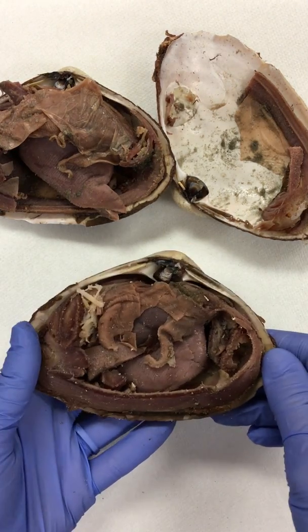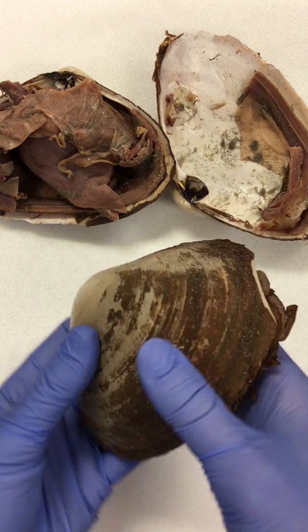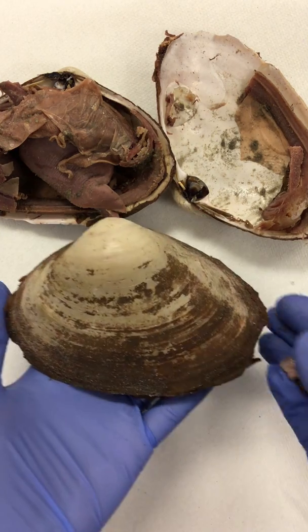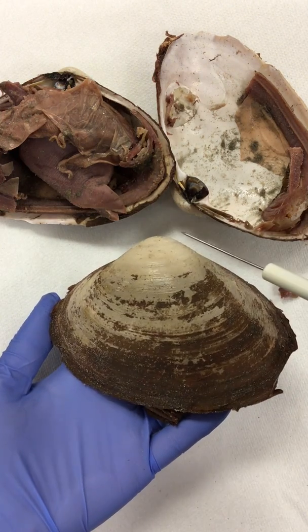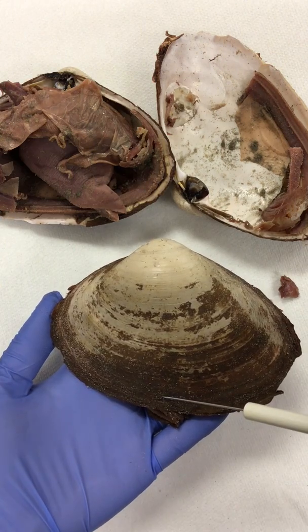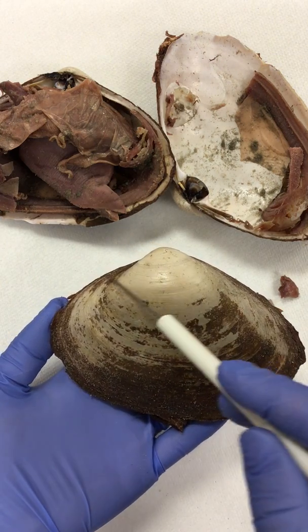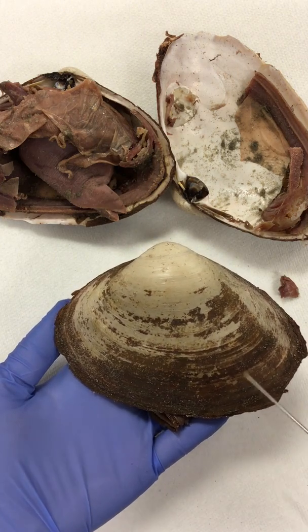All right, so what we're looking at is a clam, and it is a type of mollusk. And so we want to look at a couple of things that you need to know for this, which is orientation. If we're looking at this, you've got the dorsal and the ventral region. Then you have the anterior region and the posterior region. So how do I know the difference between these?